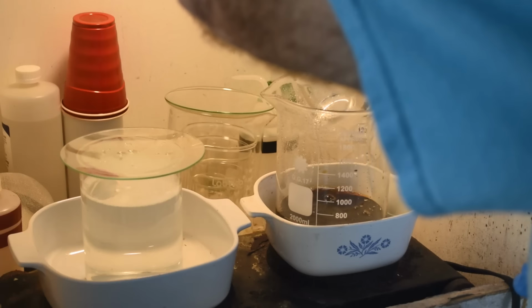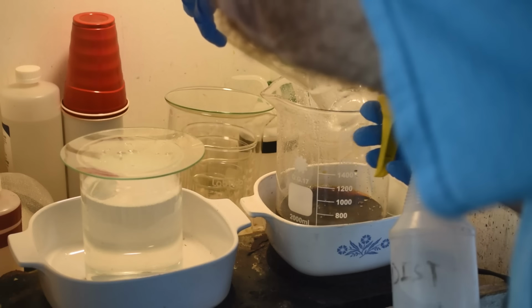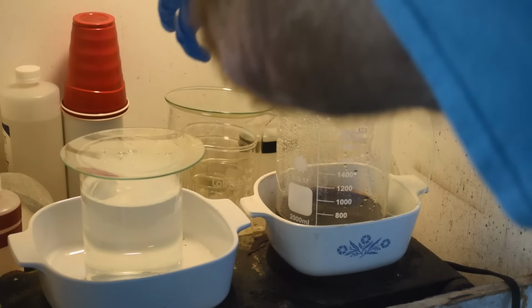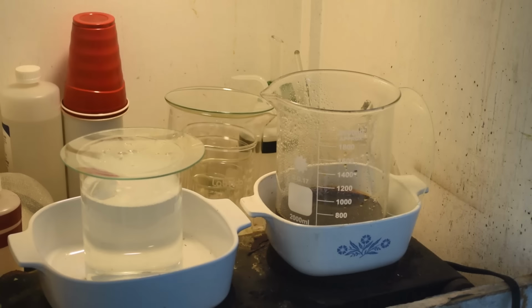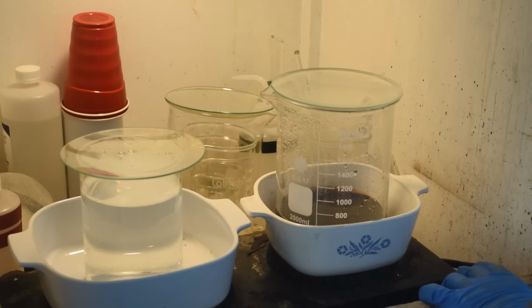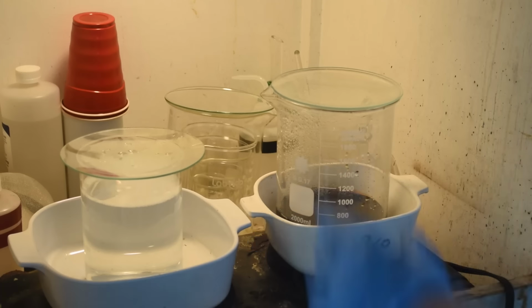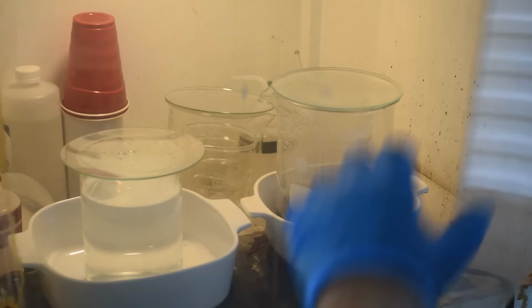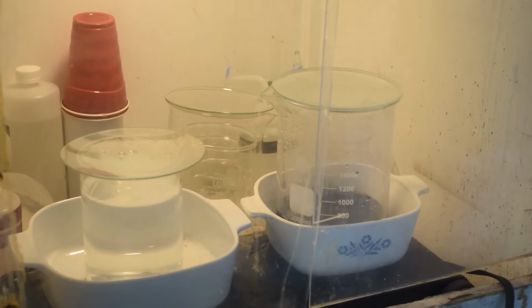Okay, that looks pretty good. Get a little bit of color in the sidearm when we wash that out. There we go. Okay. So let's see, the ammonium formate solution's already heating up. Let me get this heating up. And we'll just do that one more time. And then we should have all of the palladium.